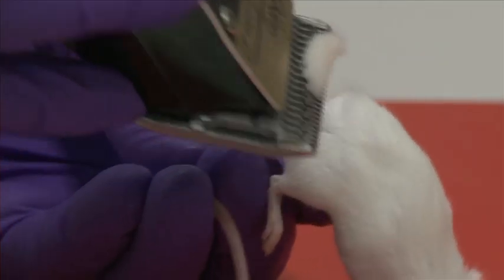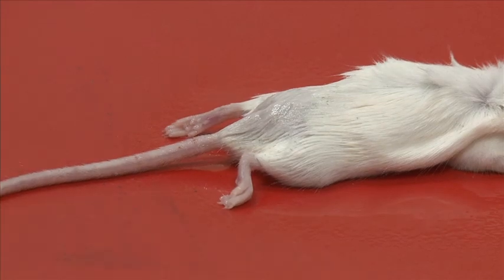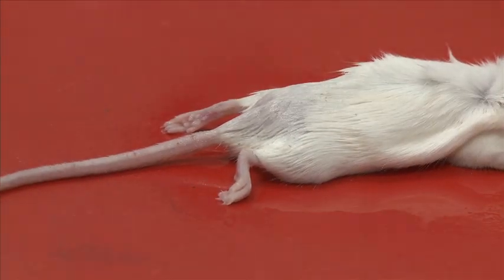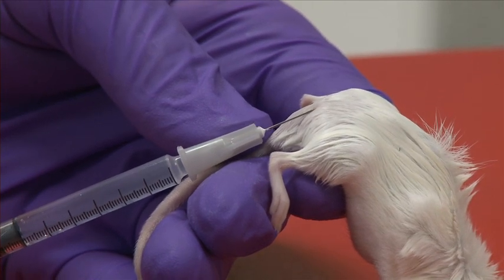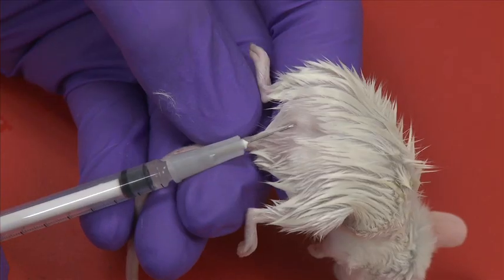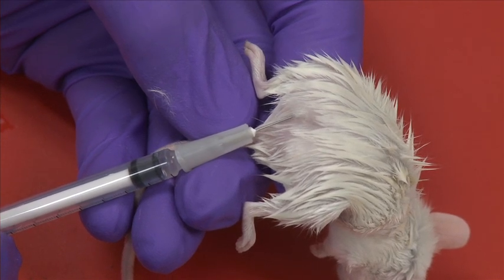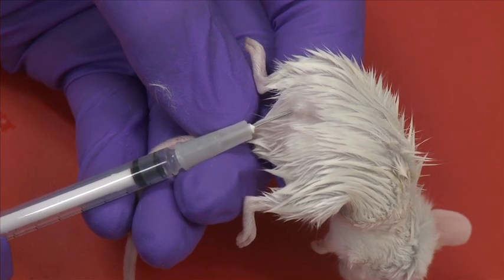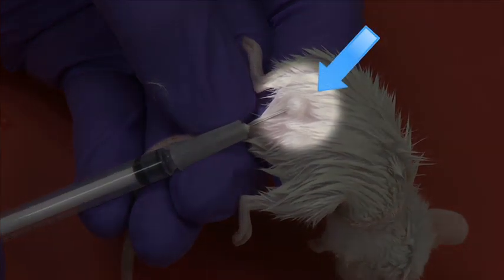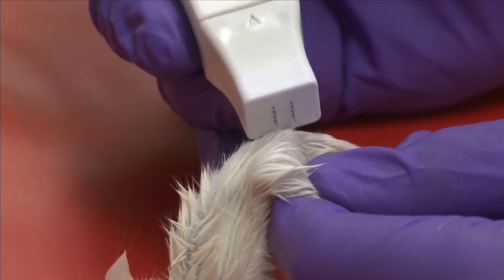Using a clipper, shave the injection site of the mouse so that the skin is visible and clean. Spray the area with 70% ethanol and wipe off the excess with a sterile cloth. Gently hold the mouse under the back legs grabbing the tail with the thumb. Pull on the skin, insert the needle with the bevel up, pushing up under the skin for a short distance. Inject 20 microliters — you should see a bleb form under the skin. Gently remove the needle and insert the needle array electrode.